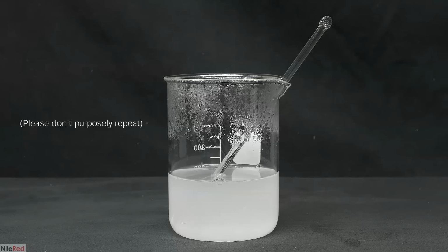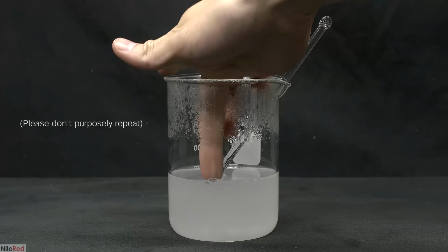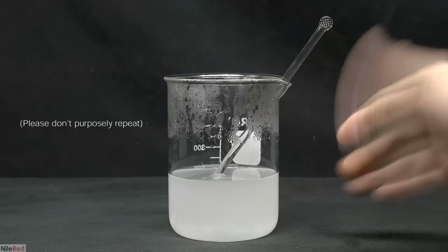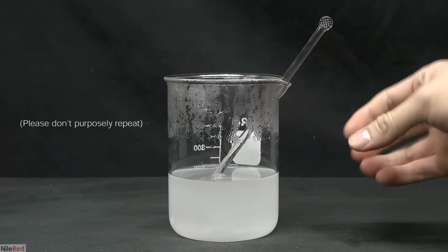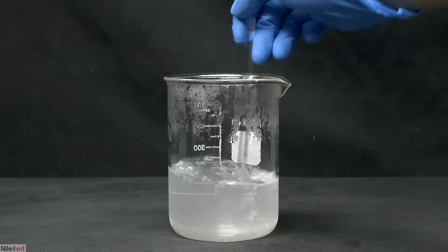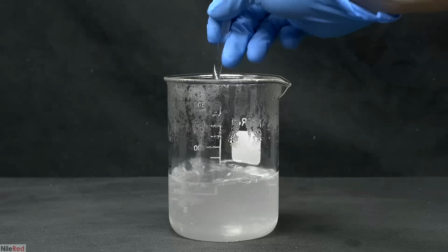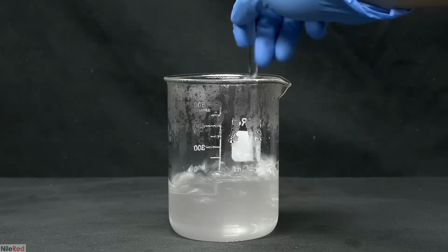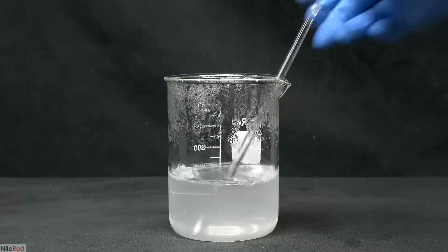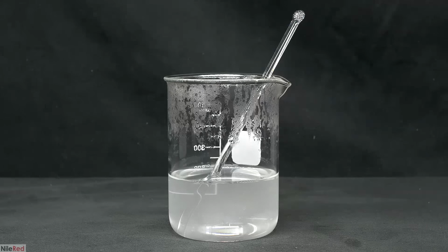Just to show you it's not the end of the world to get it on your skin, I purposely dipped my finger in. After doing this, I just washed my hand with some water, and there was absolutely no irritation or anything. Anyway, all of the sodium hydroxide eventually dissolves, but the solution is still quite hot. So I temporarily place it on the side to cool, and in the meantime, I prepare the oils.